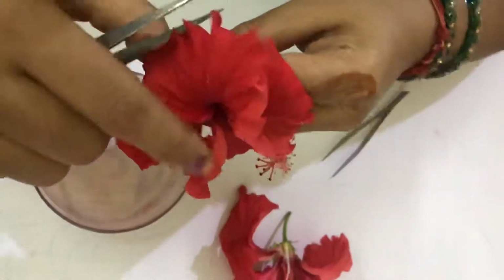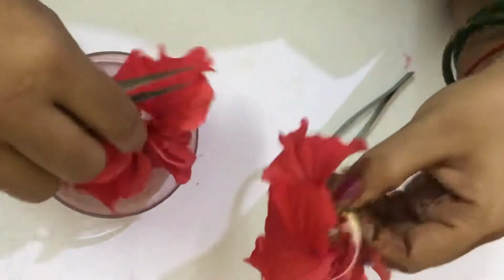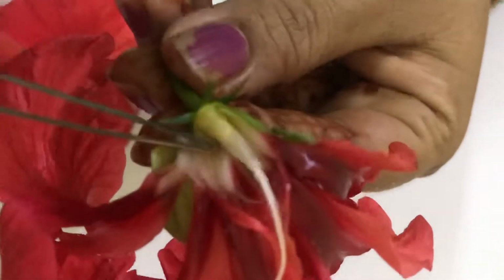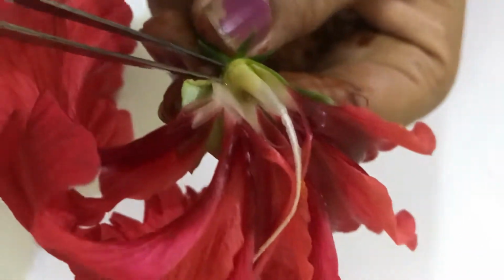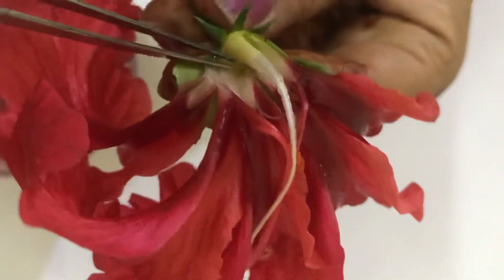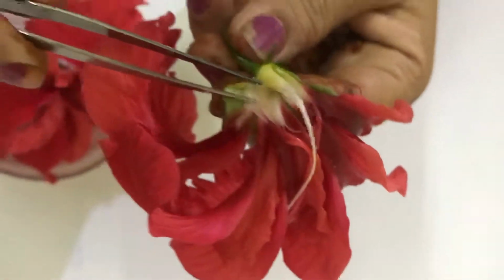The flower is a hypogynous flower. In this case, I have made it open. The floral structures, the petals and sepals, start just below the ovary. When the floral structures are below the ovary, the condition is termed hypogynous.